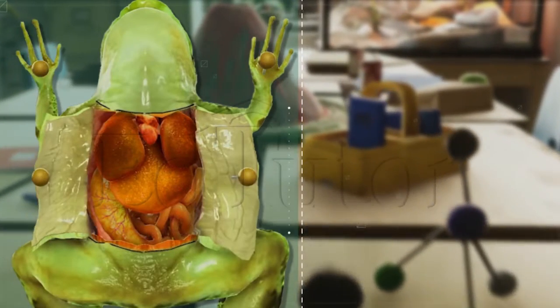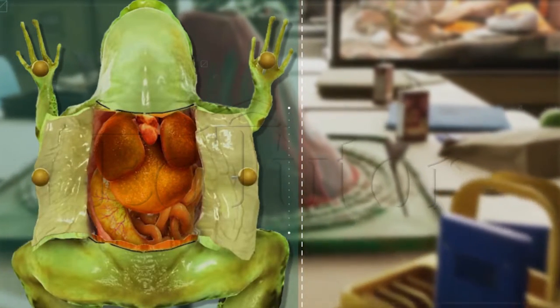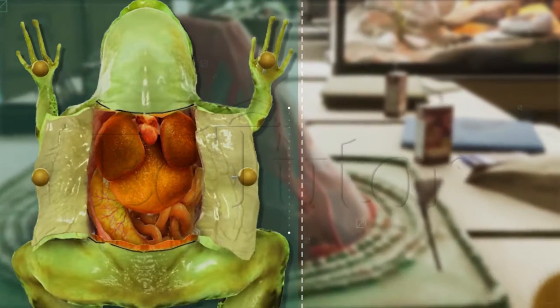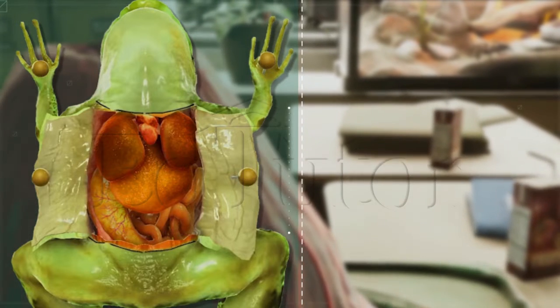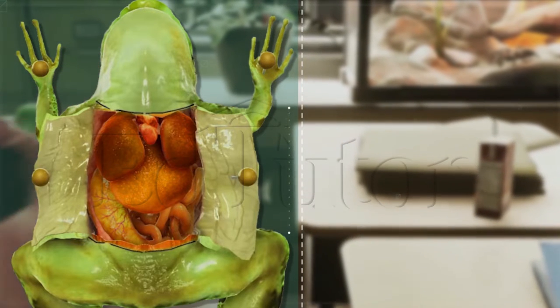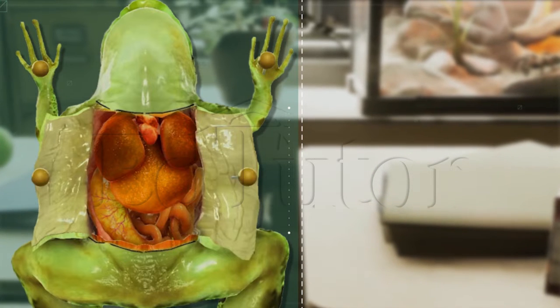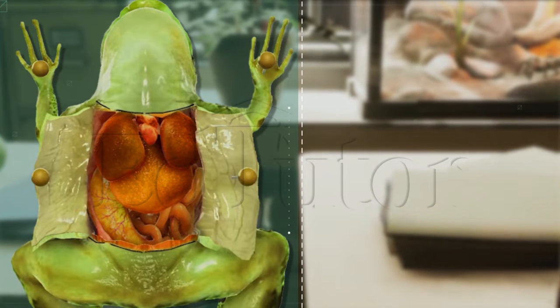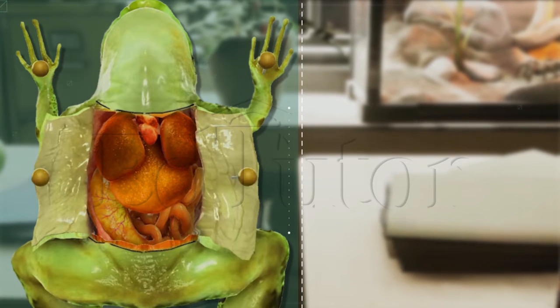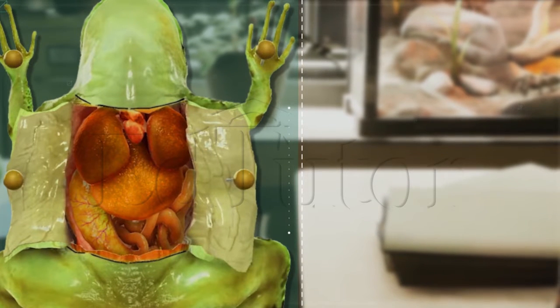I will turn and open the skin back and cut towards the side at each leg and pin the skin flat. I will also lift and cut through the muscles and the sternum to open up the body cavity so we can have a closer look.